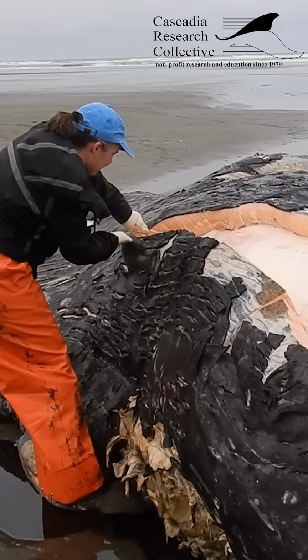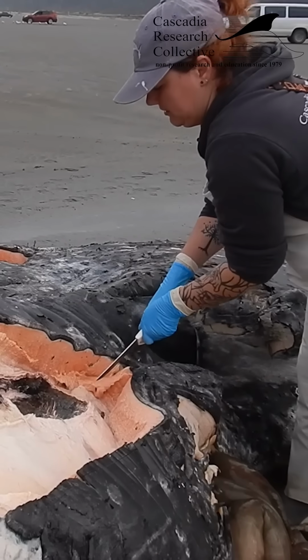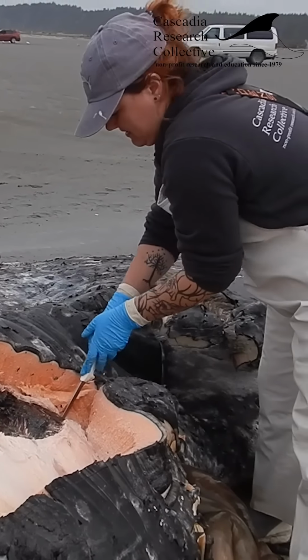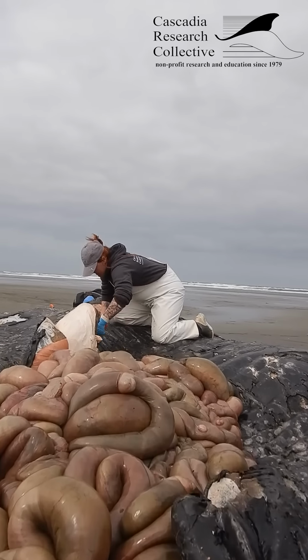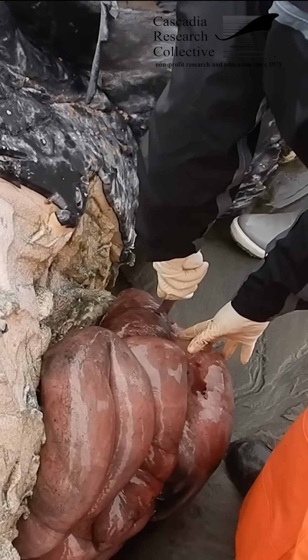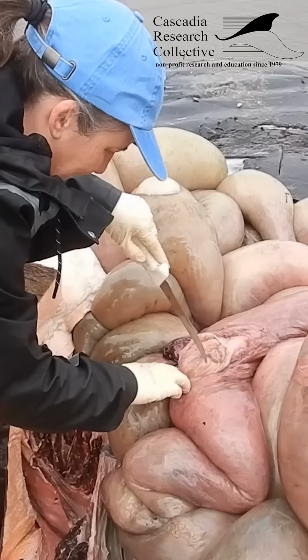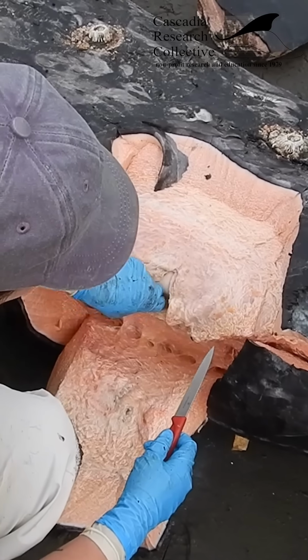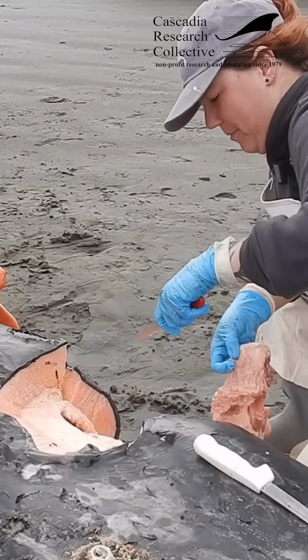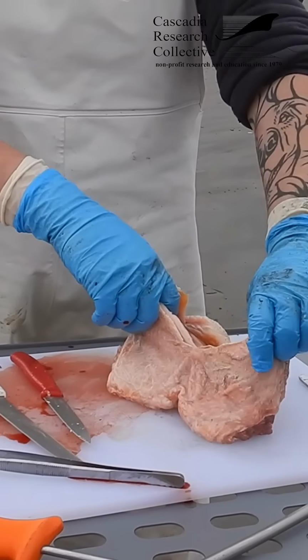Peeling back blubber and muscle, we peek into the digestive system, where we can glean vital information about the animal and its life history. Gray whales have an extensive digestive tract, including 3 stomachs and tons of intestines. It's important to look inside the stomachs and check sections of the intestines to identify what, if anything, the whale had been ingesting. Sometimes we explore areas of special interest, such as the tailstock, to learn more about whale anatomy and life history. When taking samples, it is always key to properly and safely handle, label, and store them so that they can be used for future analysis.